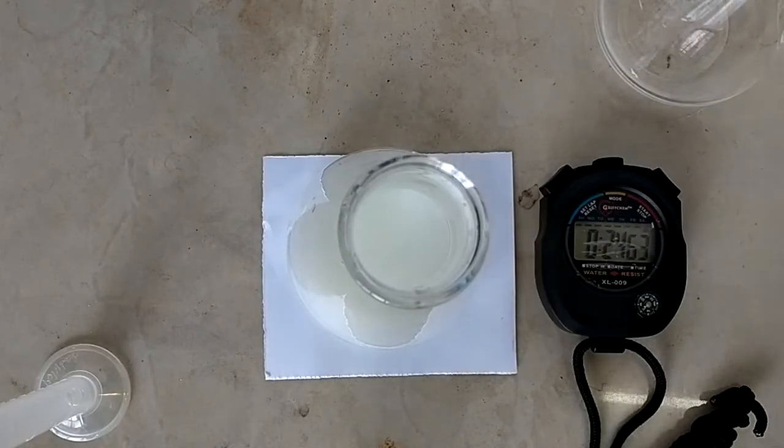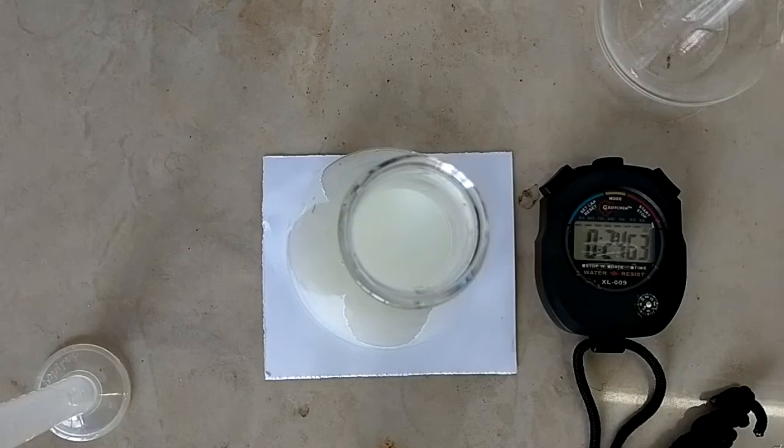So I'm going to record this in my data book and repeat the same with the rest of the solutions, but now the third one I'll be having it at 40 degrees Celsius. The next it will be at 50 and then 60 degrees.